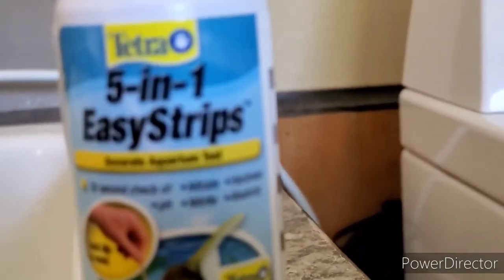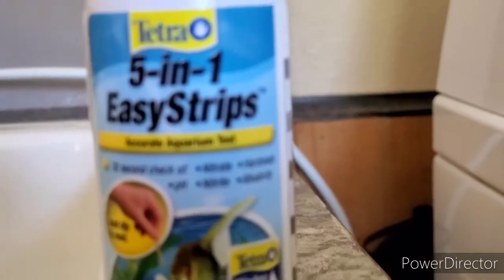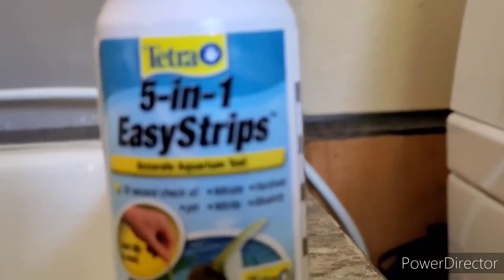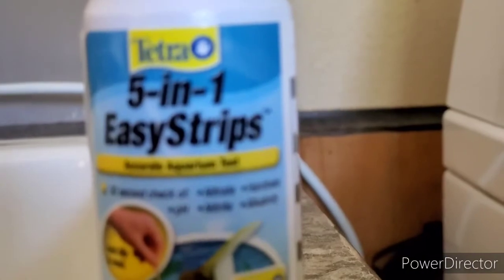I know that these are not technically the very best, like most accurate way, but it's the quickest, and easiest, and it's accurate enough.